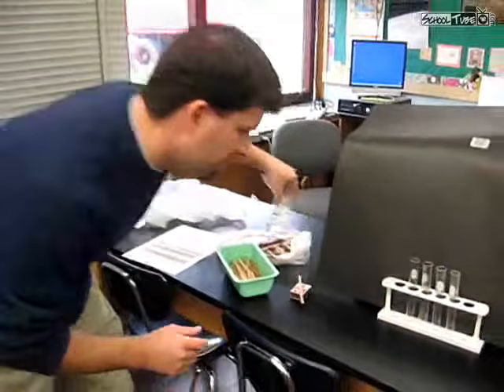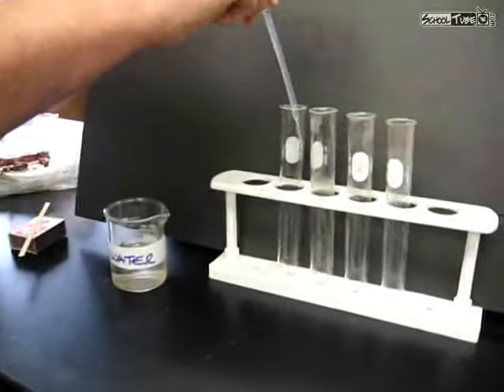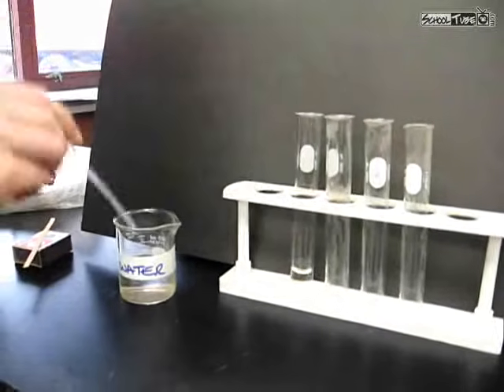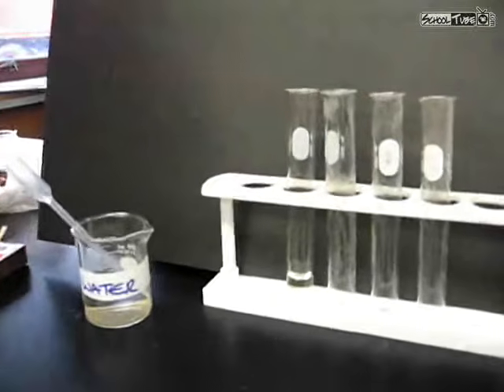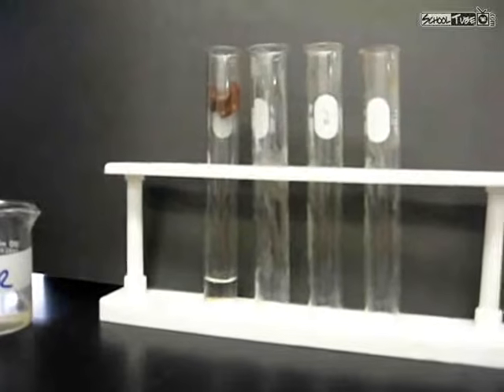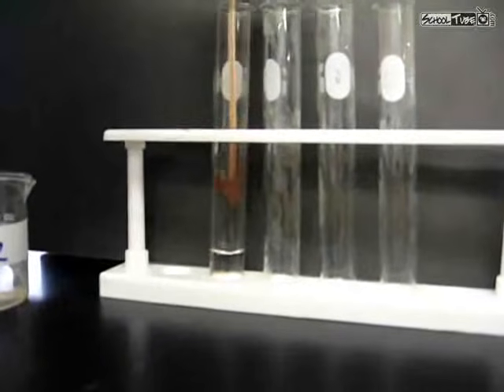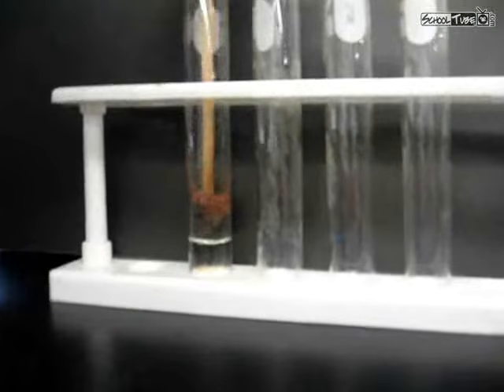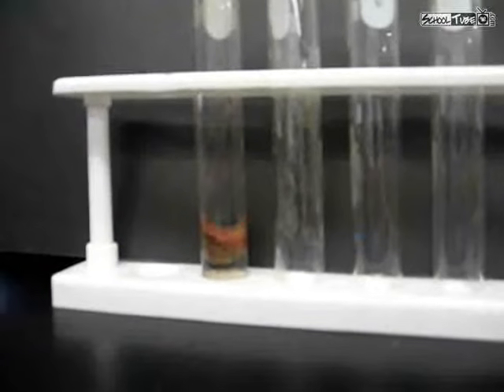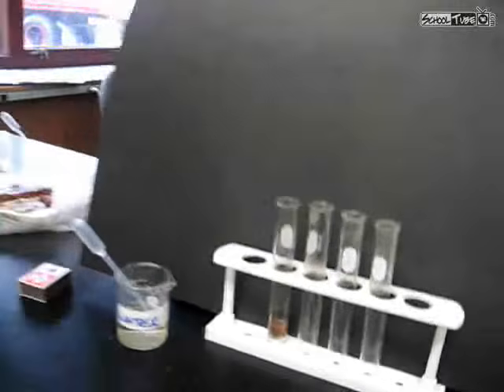What we're going to do here in test tube number 1 is add water. Water is usually what we use for controls. We're going to put that up to about a 2 centimeter mark. And then we're going to add a piece of liver. So the liver's going to go in, and we'll push that down. And you'll notice once it goes down in there, that no reaction took place. Surprise, surprise. So what was missing? There was something missing from that reaction.